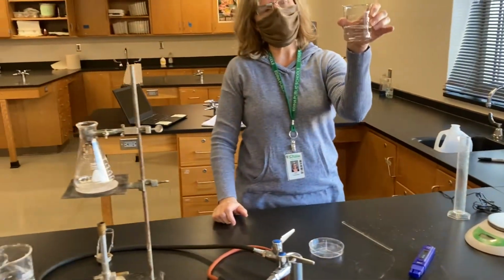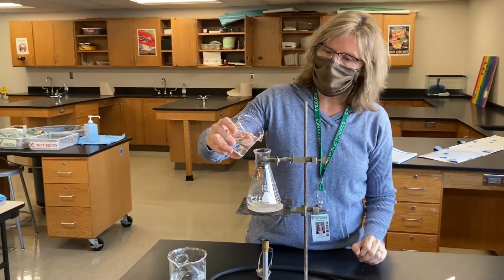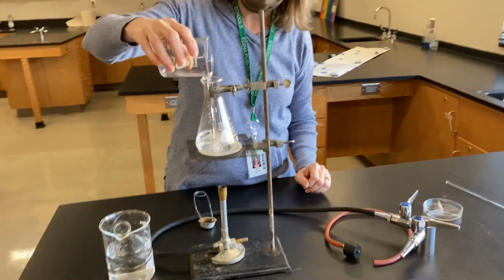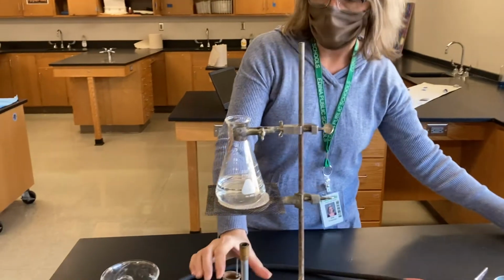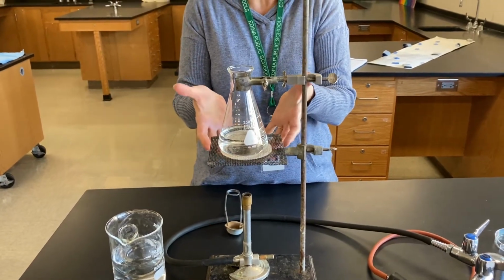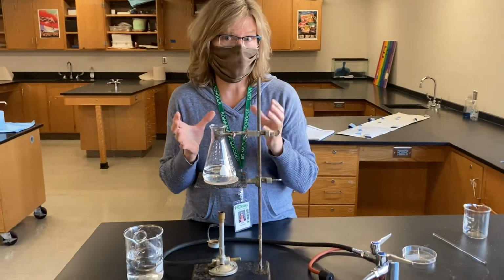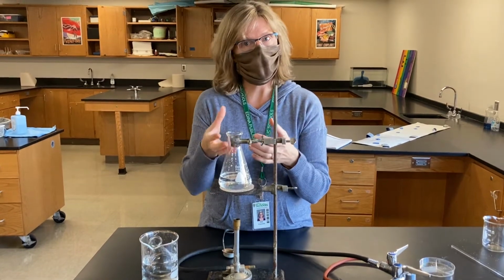All right. Now what do we do with it? Now we're going to take this salt water that we've created that's very salty, and we're going to pour it into this flask. This flask is sitting on top of a Bunsen burner, and the Bunsen burner will be like the sun. It's going to heat up just like the sun does in the middle of the day. It heats up the ocean water. And we're going to heat it up pretty intensely so that the water will begin to boil and evaporate.